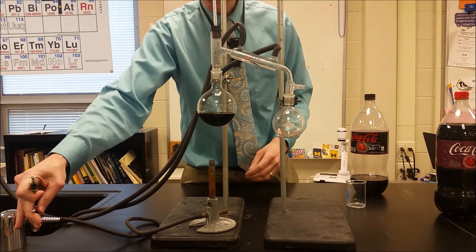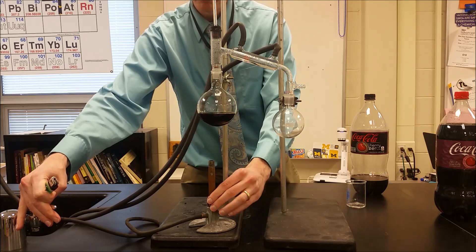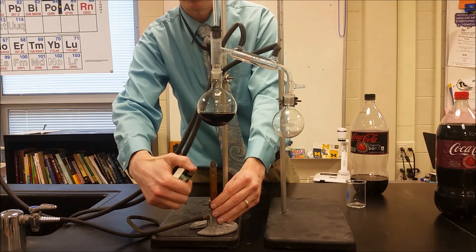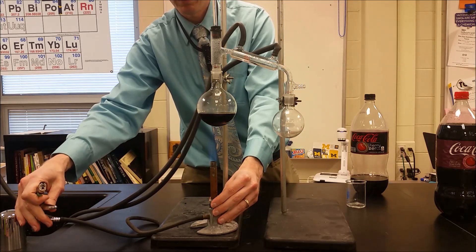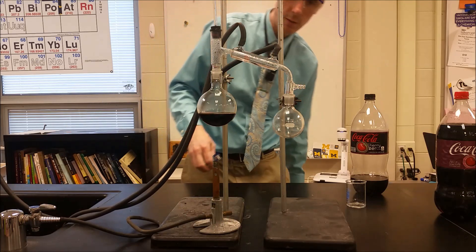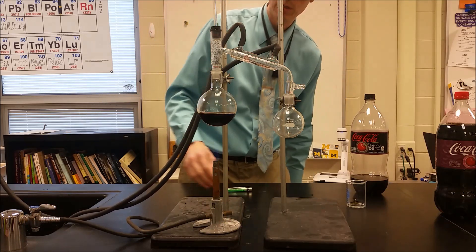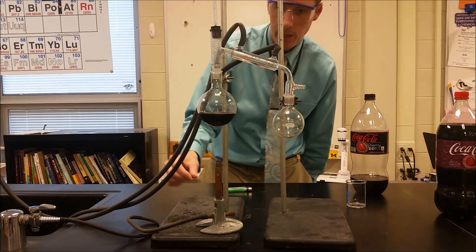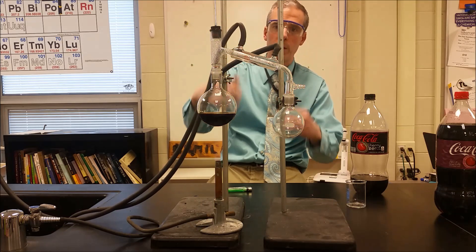And then basically to get the distillation to work, the only other step you need besides running water is some energy source. So we're going to go ahead and light this. Now we have to be careful with this one. We don't want to heat it too much too quickly because we're going to get a lot of CO2 coming out of here and we don't want it to flood up to the top.